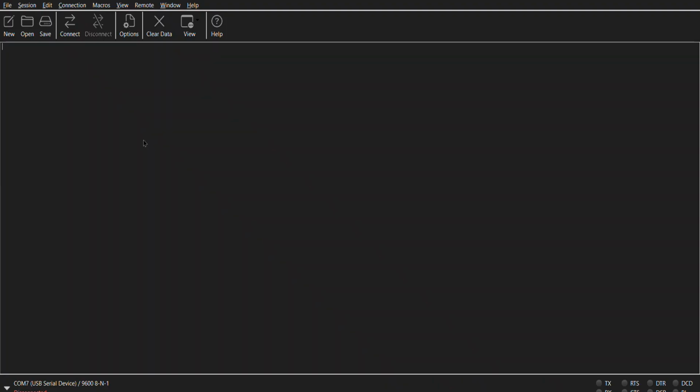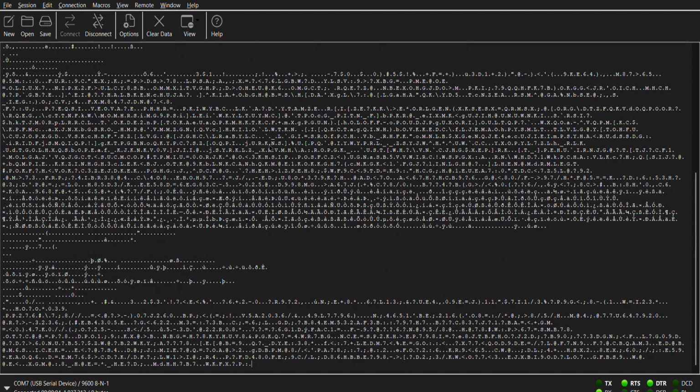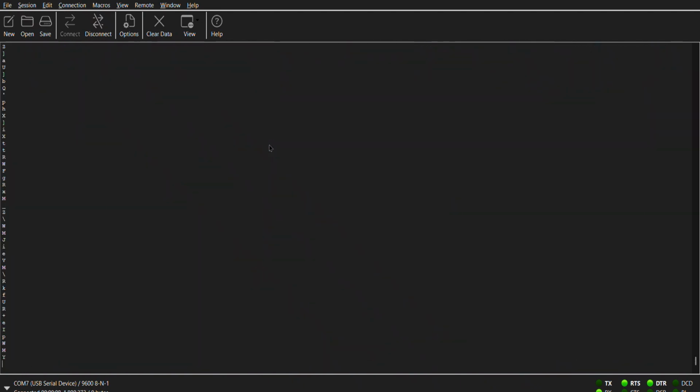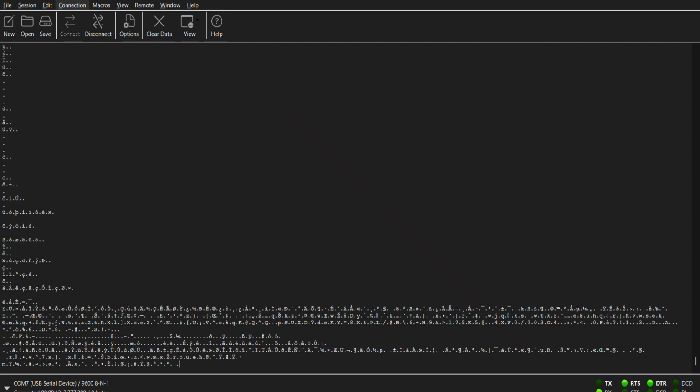Here we have CoolTerm, which is what's being used to show the raw binary data being sent over the USB using a VCP connection. The connection is being established right now, but isn't shown on the screen recorder, which only shows the window. But when we press connect, you can see the raw binary data being shown. This is when it's normal. When my hand is removed, it goes to here, which shows the lighting change.